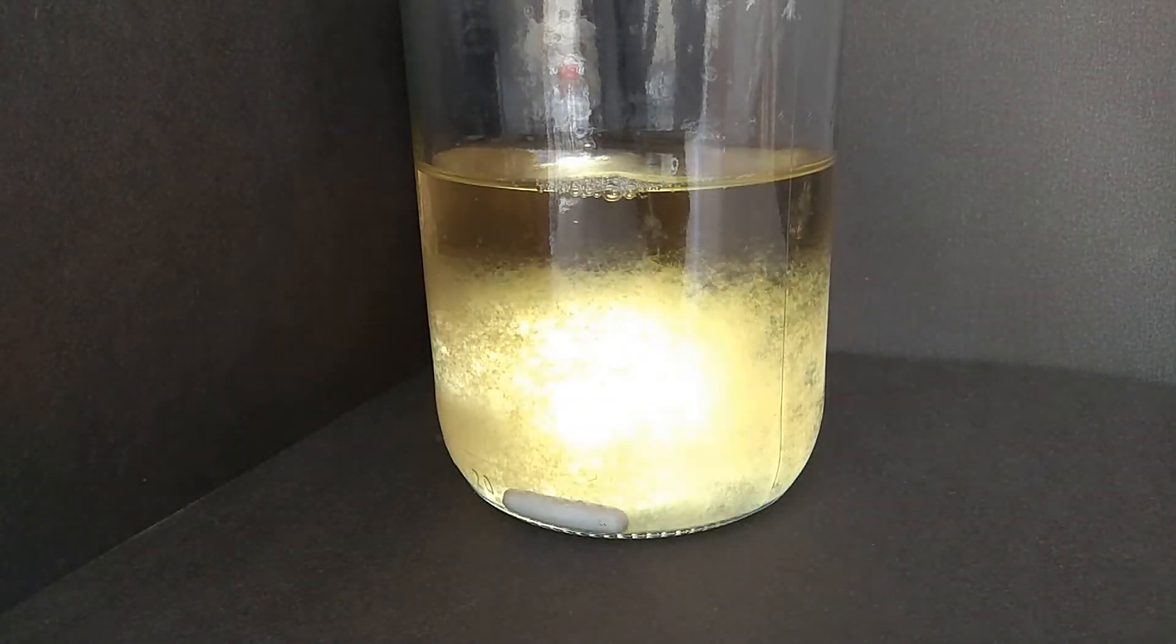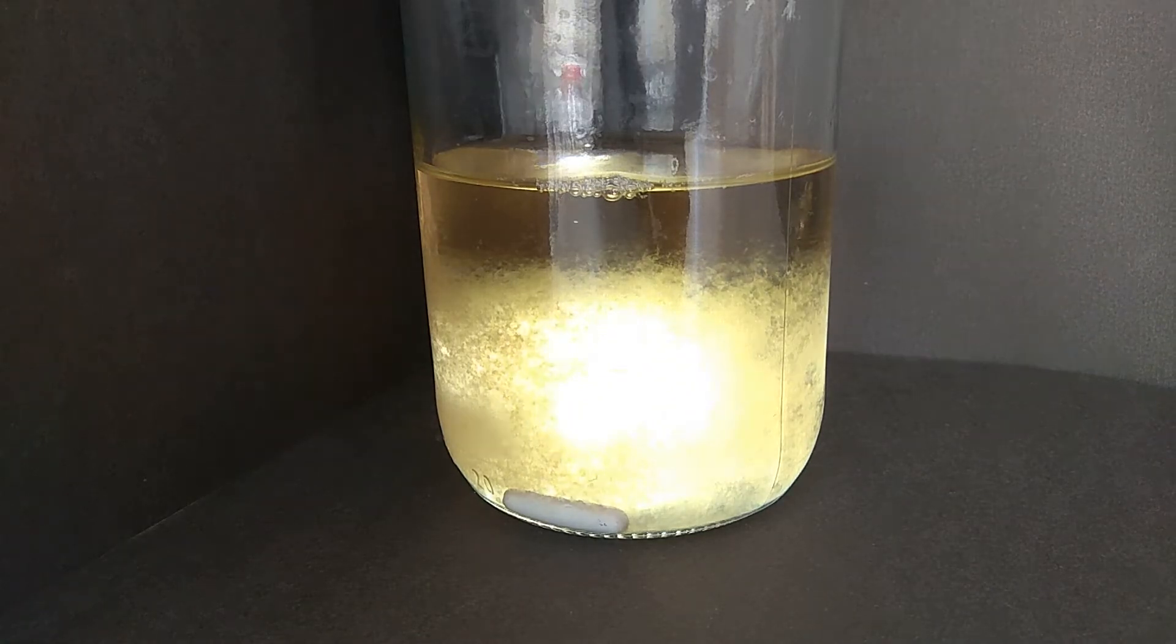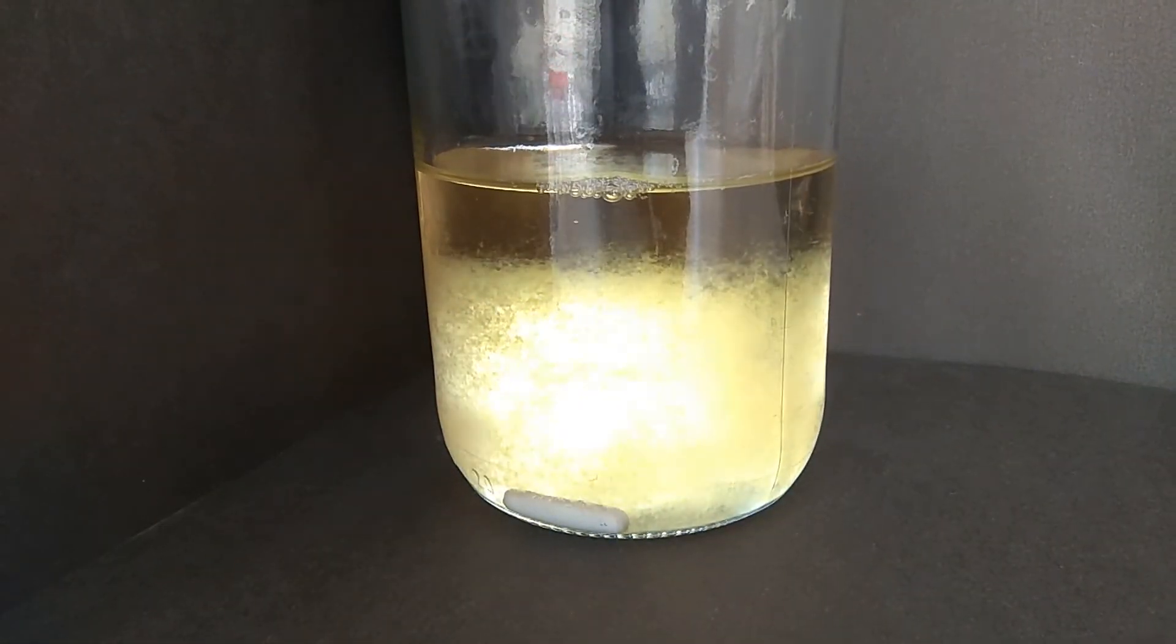Today is the 15th day. More than half of the jar has formed mycelium. The upper part of the liquid is very clear. This shows that our culture is healthy.